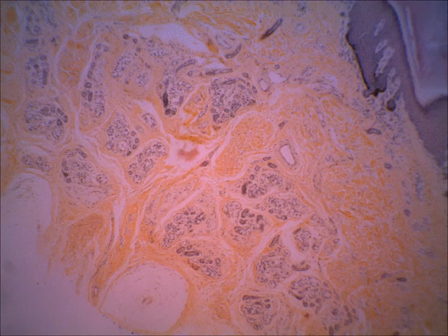It's a different one. I can tell it's the skin because up here at the top I see the epidermis, and I can see little portions of dermal papillae in that. Now this is sectioned kind of strangely, so you don't see the dermal papilla coming all the way down towards the dermis just because of the way it's sectioned.